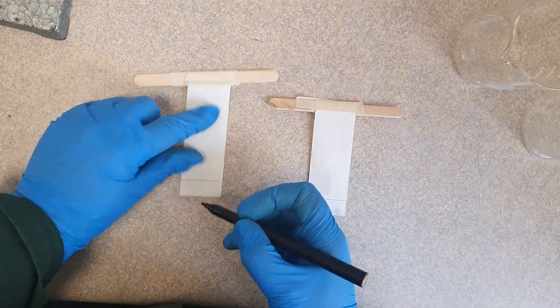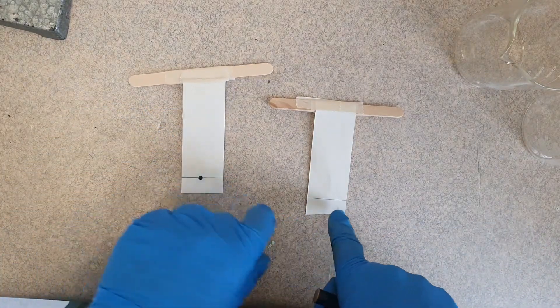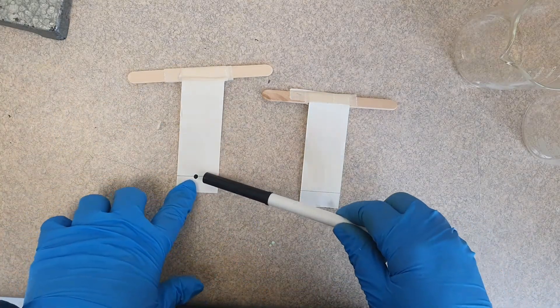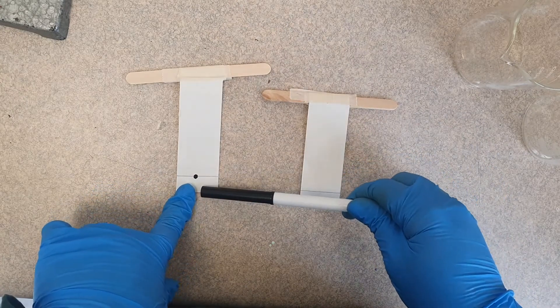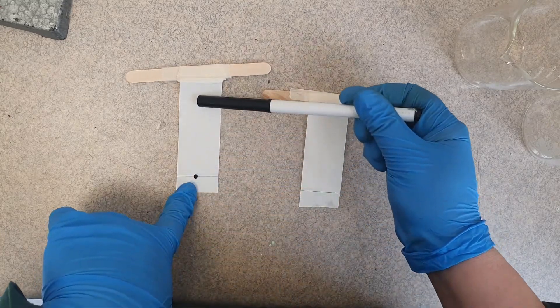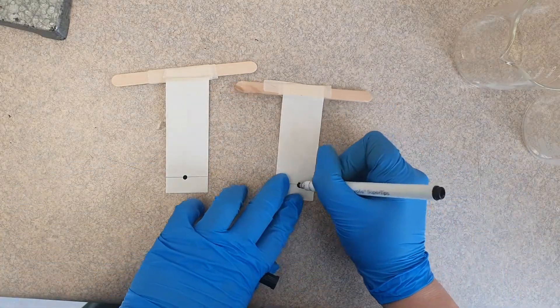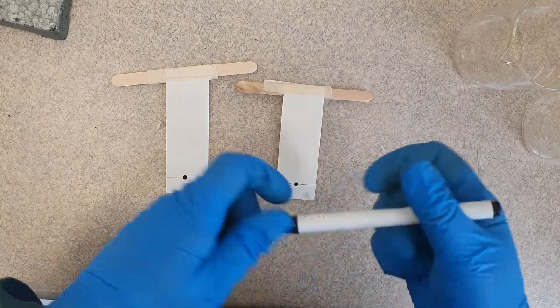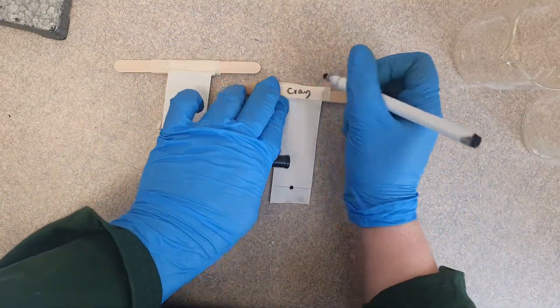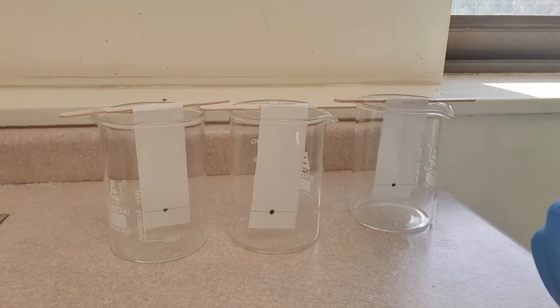I've got two more pieces of paper. I'm going to try separating colors from this connector pen on one. Same deal — a little dot at the bottom. You may have noticed I've drawn a little grey pencil line here as a guide of where to put the dot, and then we can measure how far the color has traveled. I'll label this one 'Crayola' so we know the difference, and this one 'connector pen'.